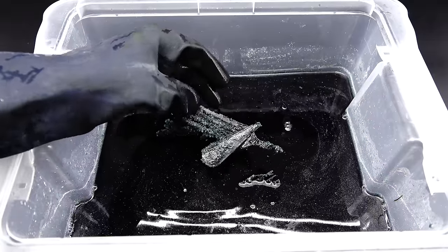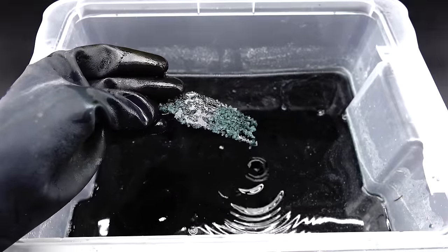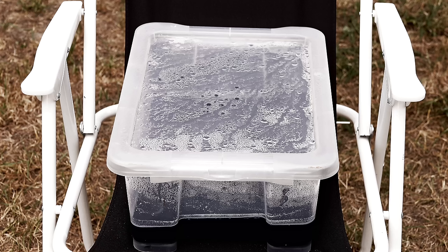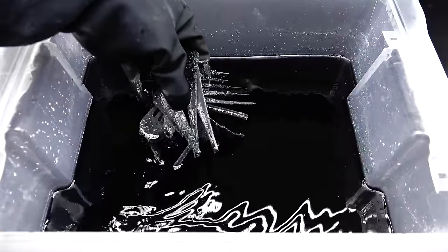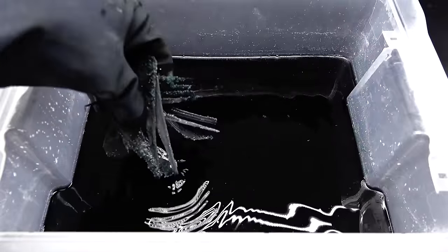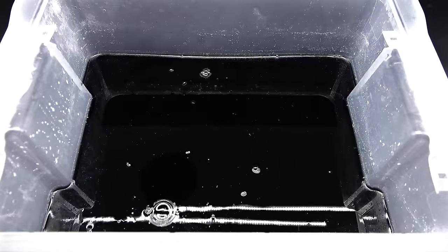Unfortunately, a lot of the iron sulfate crystals encased my partially dissolved forks, making it harder for the acid to eat them away. To fix that, I again got everything onto the solar chair to at least partially dissolve the crystals and left it to react for another couple of days. When I came back, the forks looked much thinner. I could theoretically let them react for some more time to dissolve them completely, but I already spent like a week on this project and wasn't even halfway done, so I just proceeded to work with what I had.